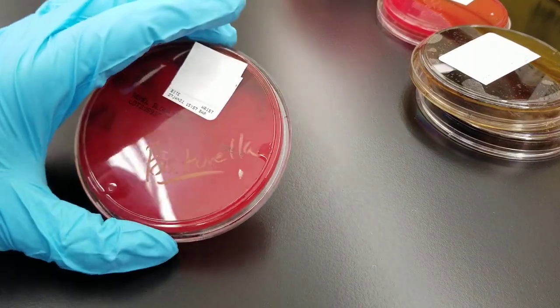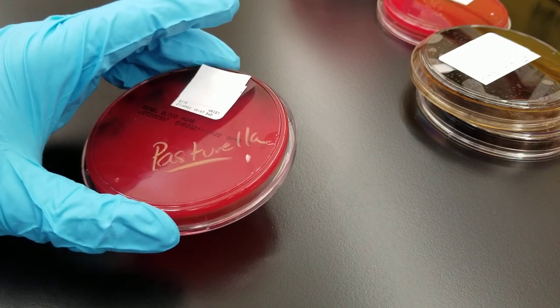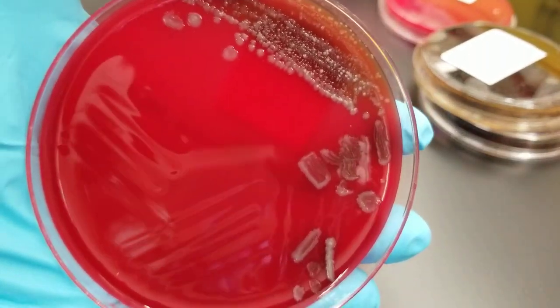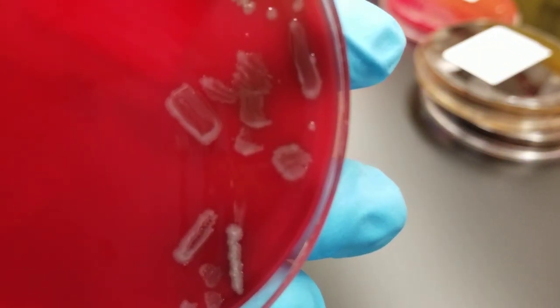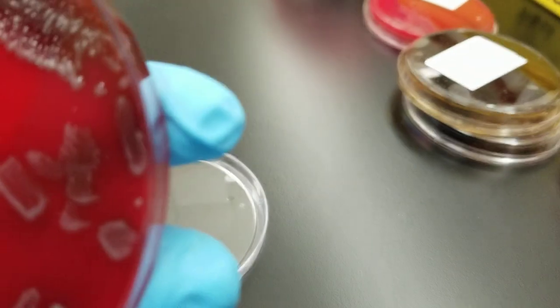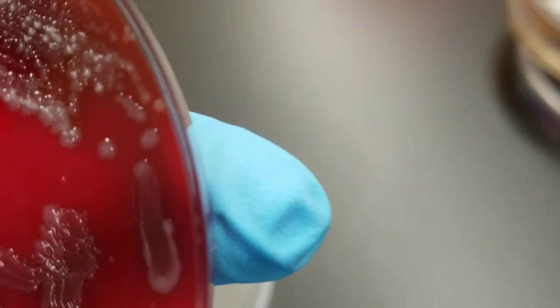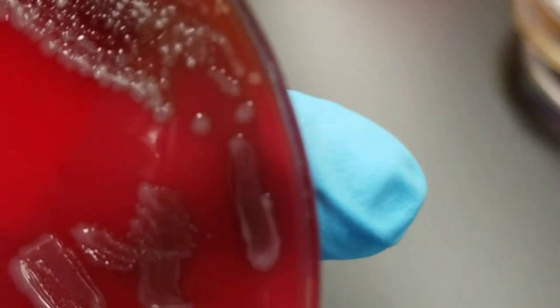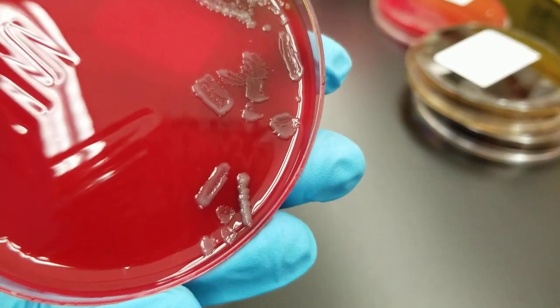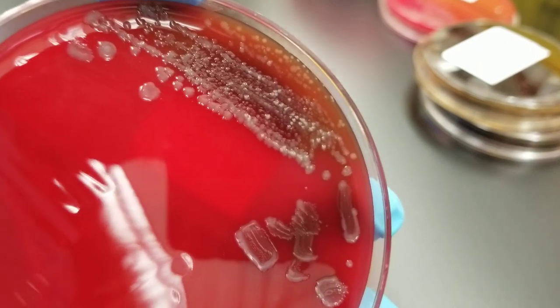We have a couple of different cases today. This one ended up being Pasteurella — it's a bite on a person's wrist. What you see there is not what a colony looks like — they swiped it with the loop, which is why it looks spread out. A colony would be the circular type up here. It's nice and has a kind of wet sheen to it. This would have been an animal bite on the wrist, and Pasteurella is very common in an animal bite.